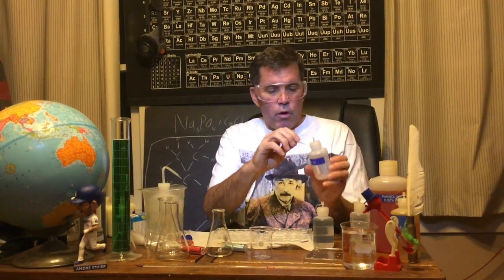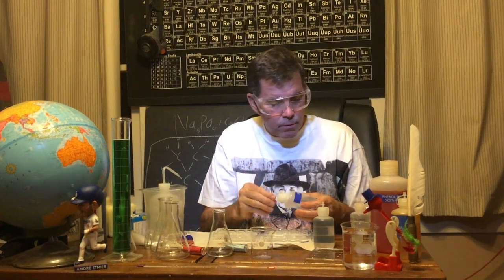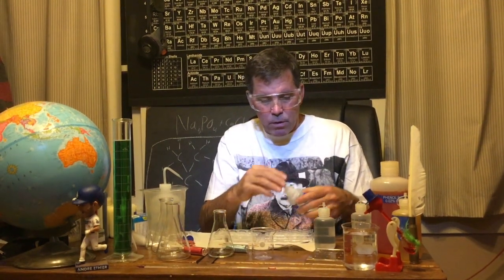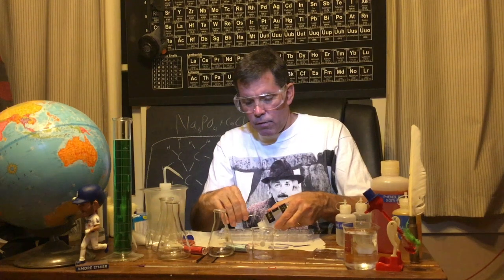So this is salt water. And sodium hydroxide. Sodium hydroxide is a strong base. And lastly, ammonia, aqueous ammonia, which you know is a weak base.